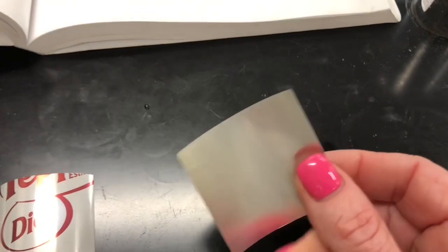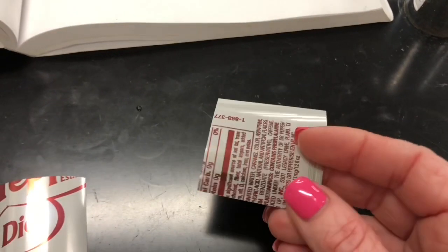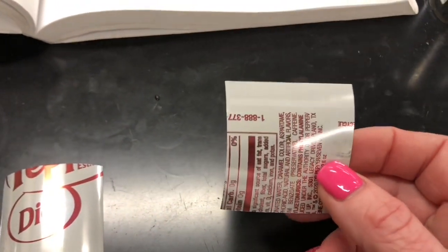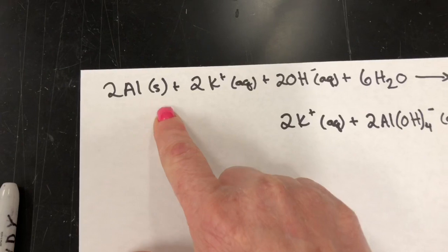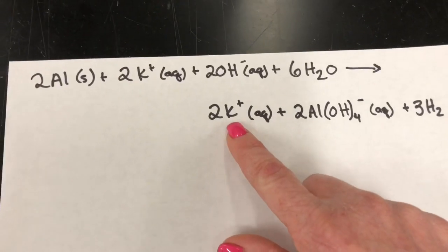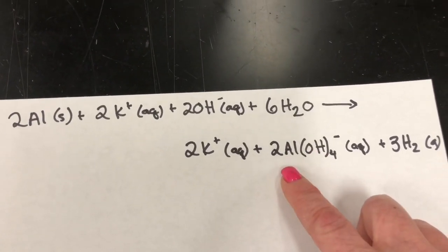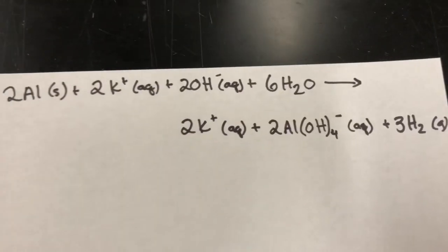I use 25 mils of 1.4 molar potassium hydroxide to dissolve this with a little bit of heat. You're going to see that it makes bubbles — that is hydrogen gas evolving. Our first reaction: we take solid aluminum and react it with potassium hydroxide in aqueous solution. Potassium is a spectator but we leave it in because it shows up in our final product. We make the tetrahydroxylaluminate ion and we see bubbles — that's hydrogen gas. That's our first reaction.